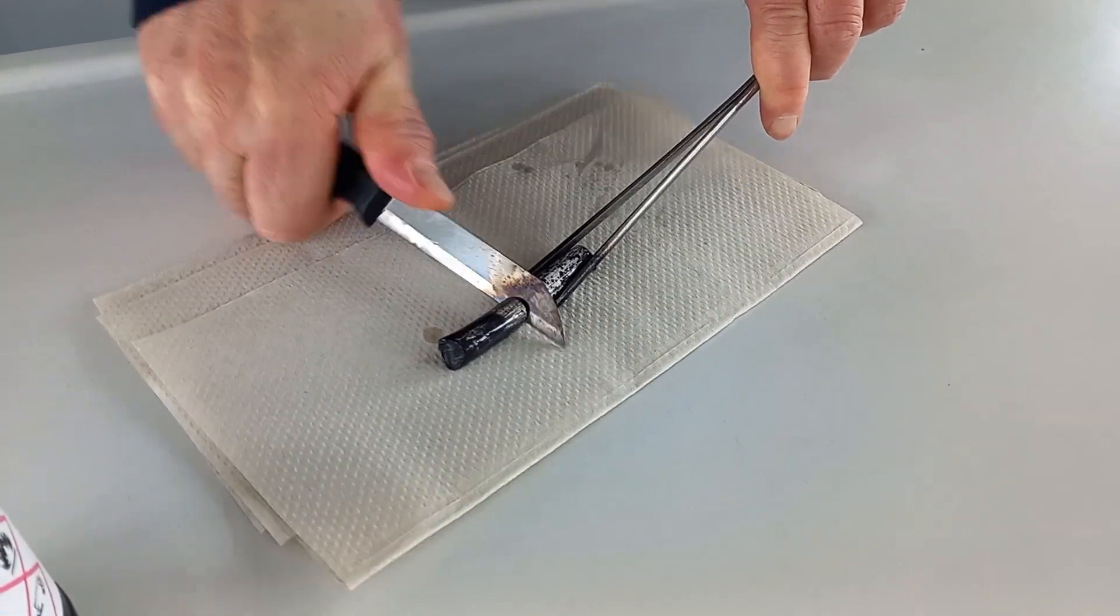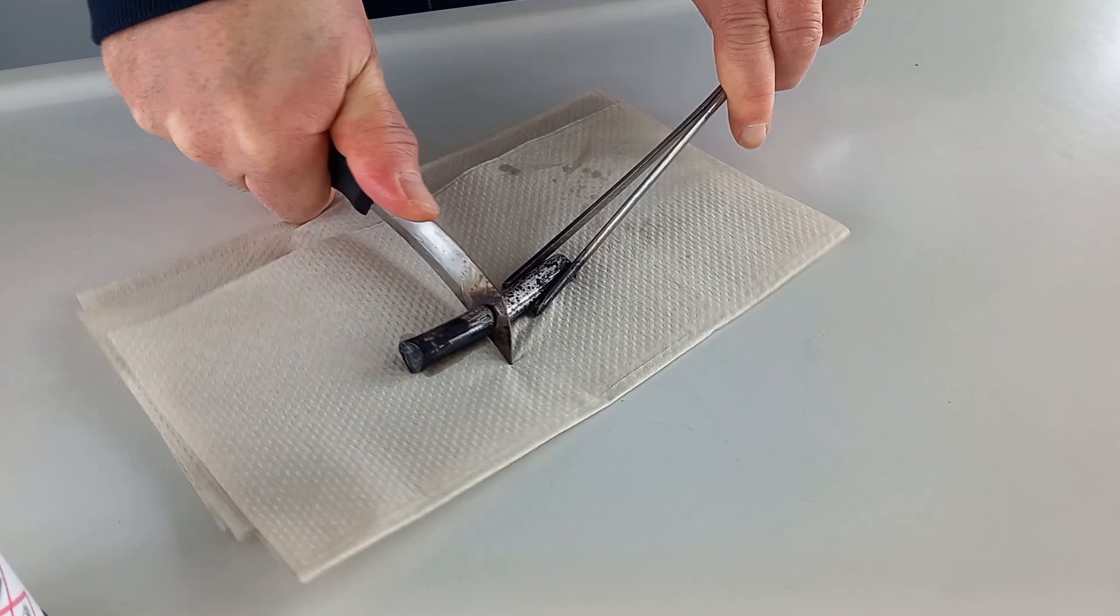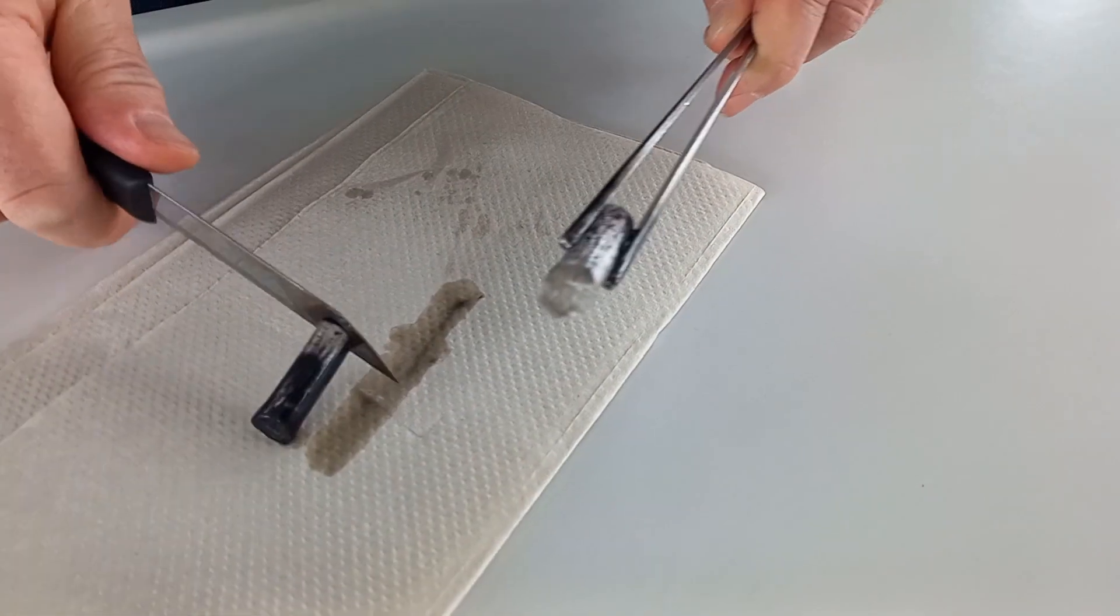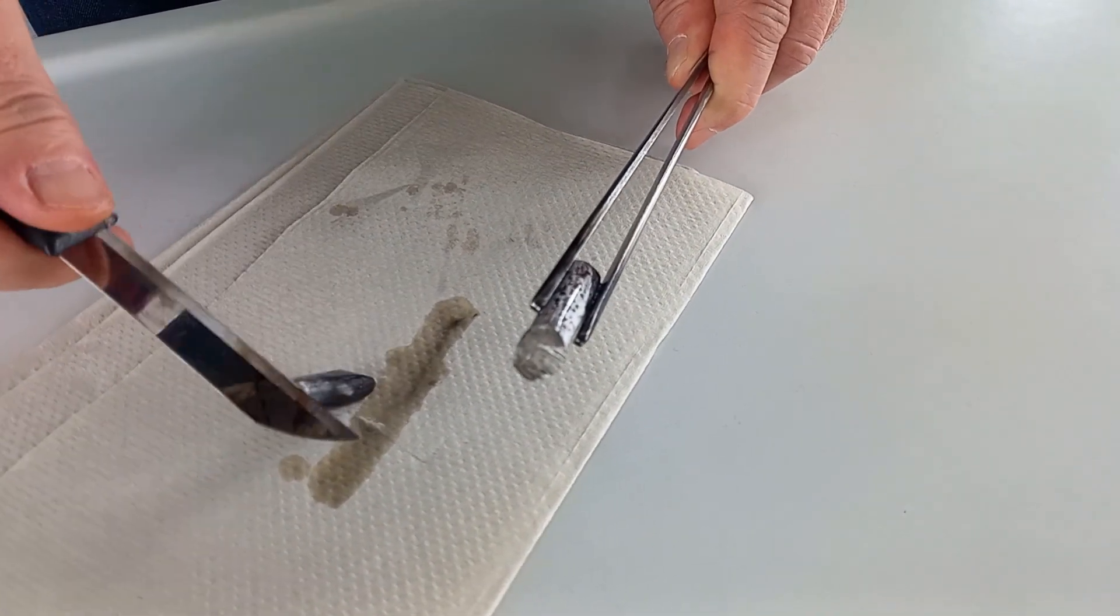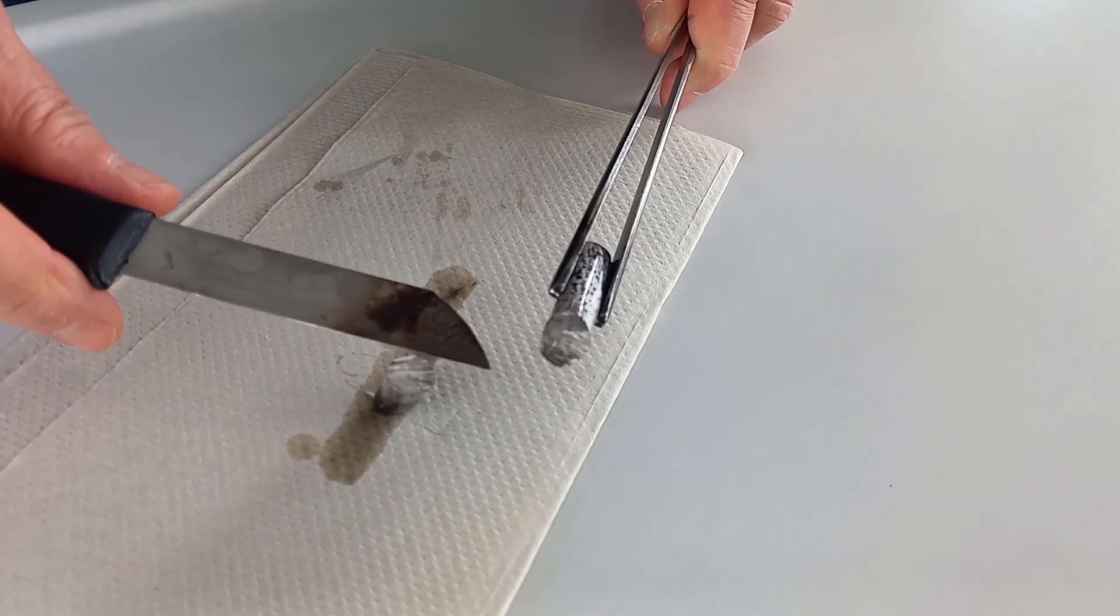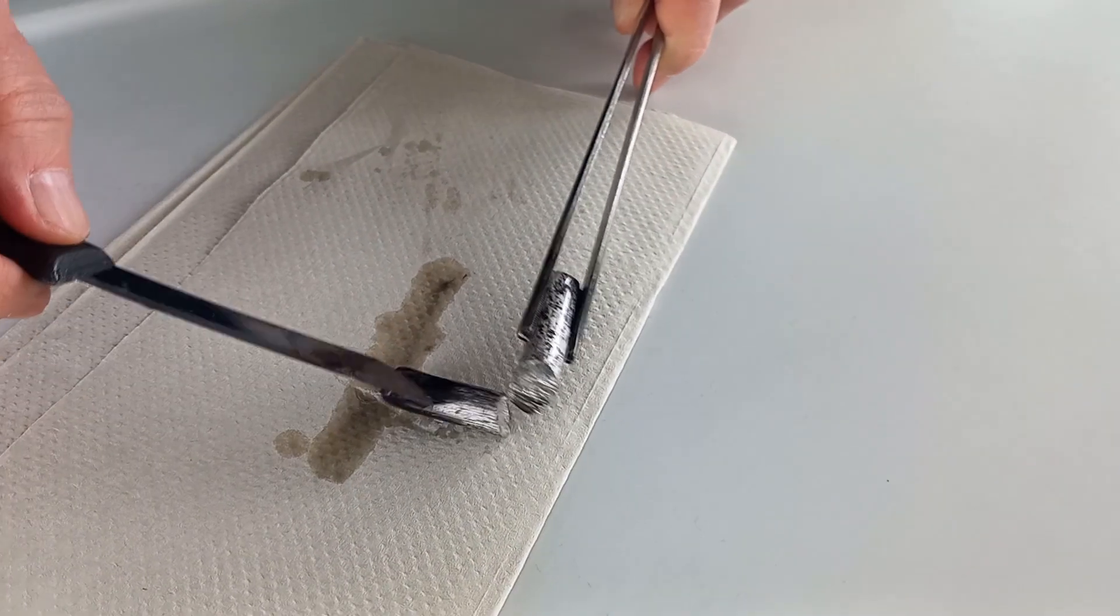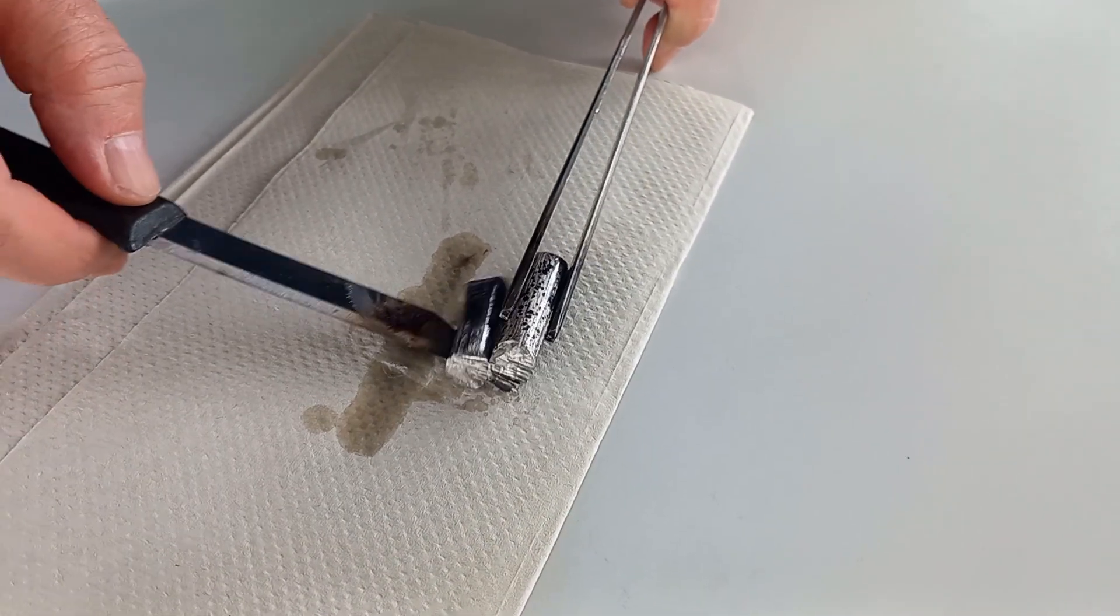Outside, the lithium has oxidized with the air. On the carved side, you can see the shiny metal.